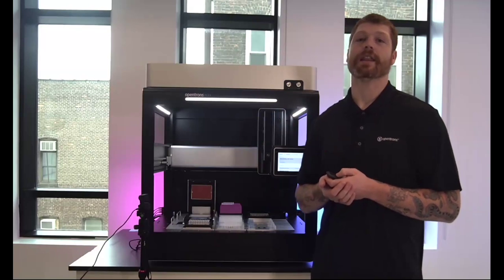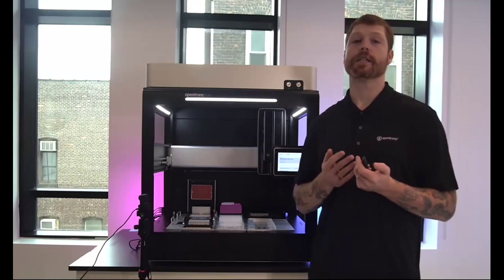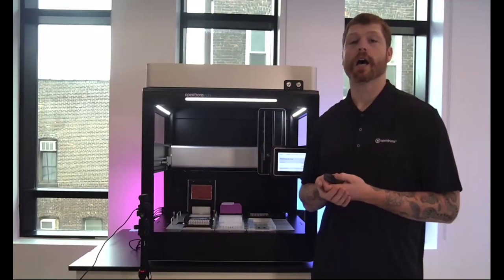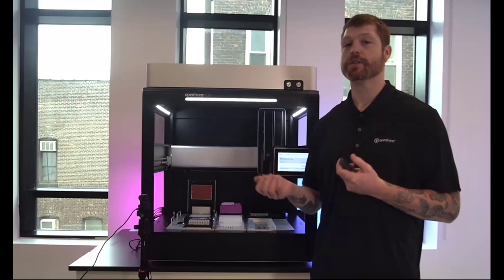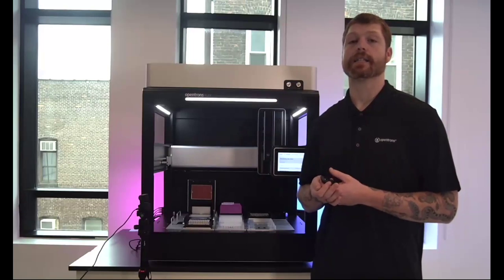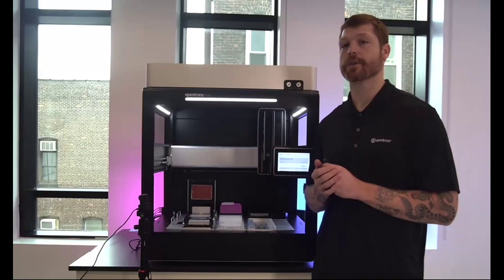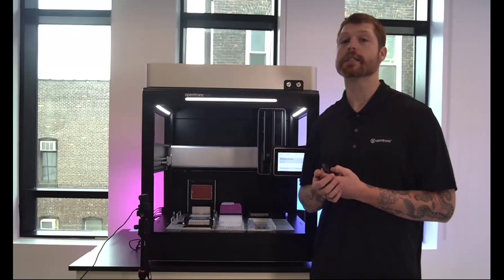Then the next two features that I'll talk about are what I will be demoing today. The first is what we call quick transfers. This is going to be the ability to directly on the touchscreen specify a transfer protocol. All you need to do here is specify the pipette that you'll be using out of the 2 that are configured, or the 1 if you have a 96 channel, and then select the tip rack and 2 labwares, your source and your destination. So this is totally code-free. It's all right on the touchscreen. It's entirely UI driven. And I'll demo to you today how easy that is to set up a protocol.